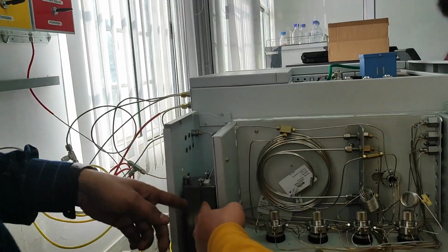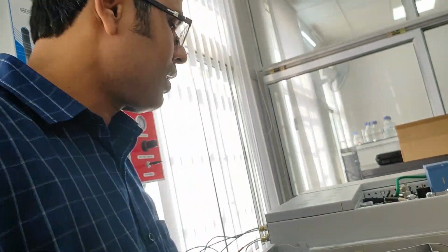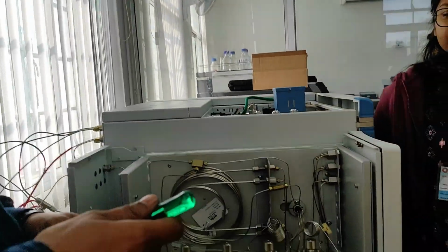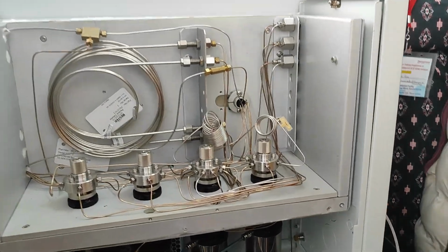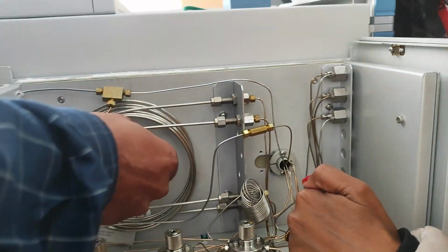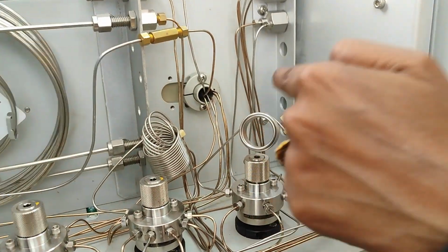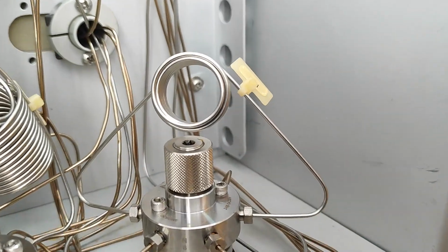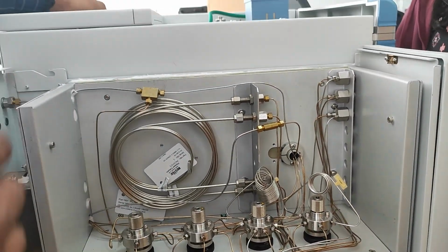Which one is the methanizer? This one. Yes. Don't touch, this is above 300 degrees. Can you show me the sample loop? Which loop is filled? This one? No, this is the column. This one is okay. So show me the molecular sieve column. Which one is the molecular sieve column?